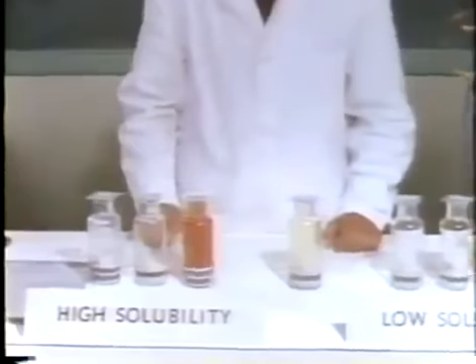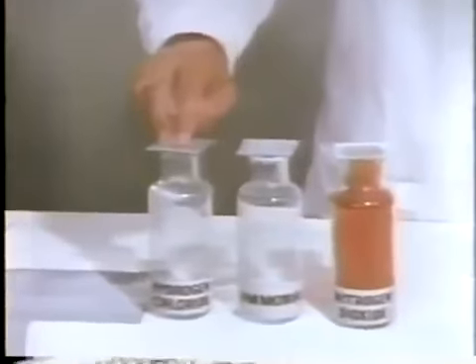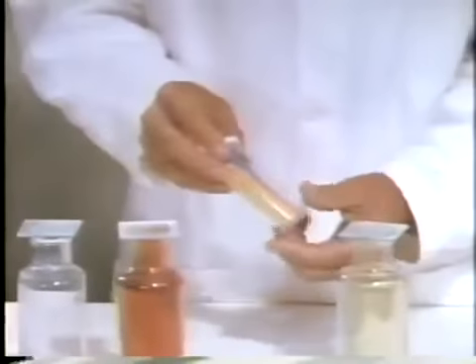We still have not distinguished these two gases, ammonia and hydrogen chloride. The dye, bromcresol, will help us. These pieces of paper have been soaked in an alcohol solution of the dye. Let's see what happens when the dye comes in contact with ammonia.